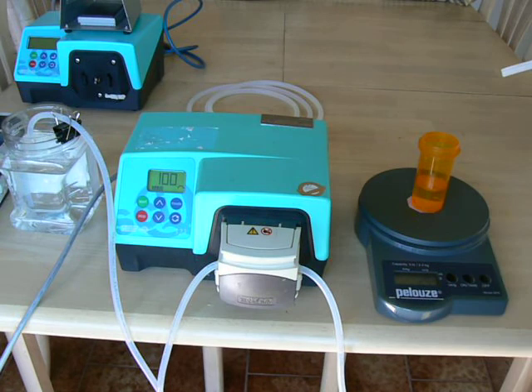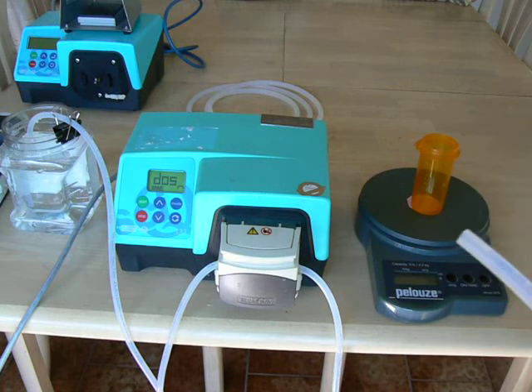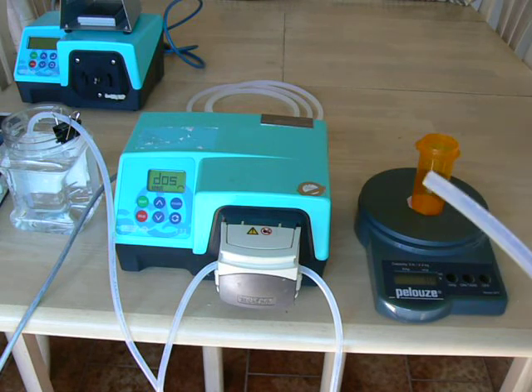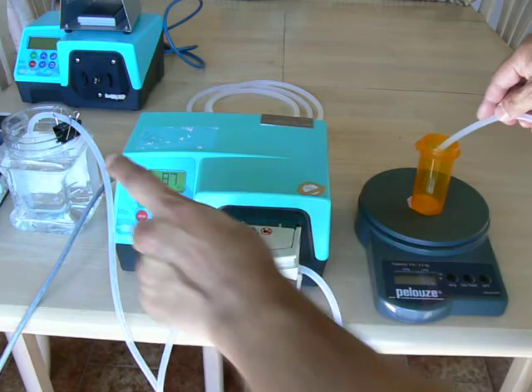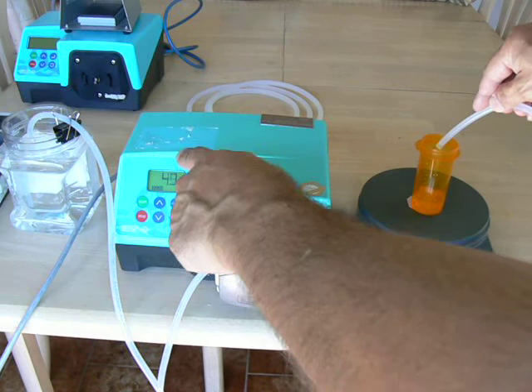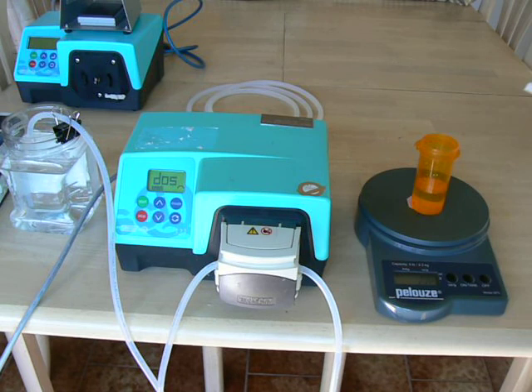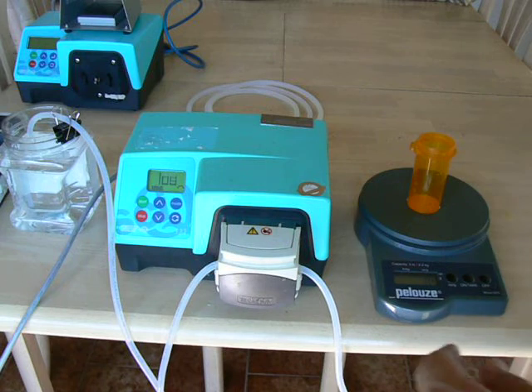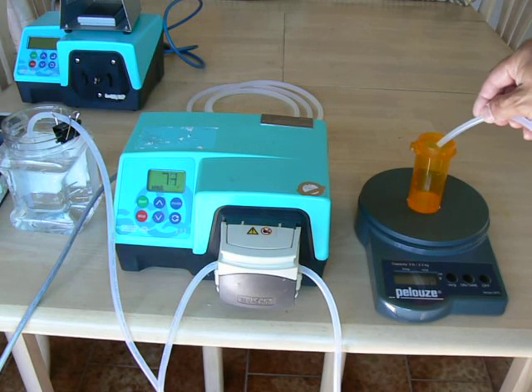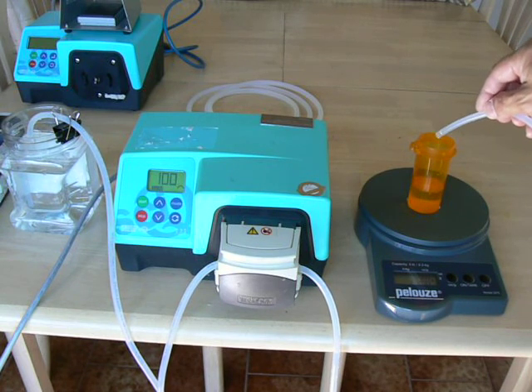So we hit stop, and it looks like it went to 29 grams. If you look at the display, you'll see it has changed from RPM — now it flashes between 100 and DOS. DOS meaning the dose function, 100 meaning 100%. If we hit the start key, we should get that identical volume dispensed and the pump will stop on its own. You can see it counts down from 100% to zero. And we've got 28 grams. Let's try another — and again, 28 grams.